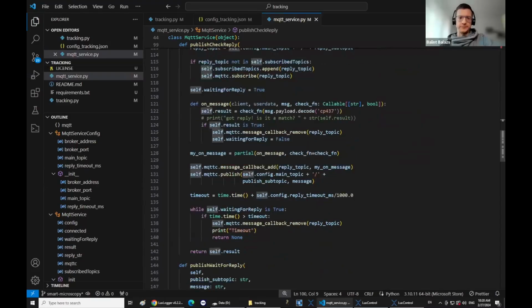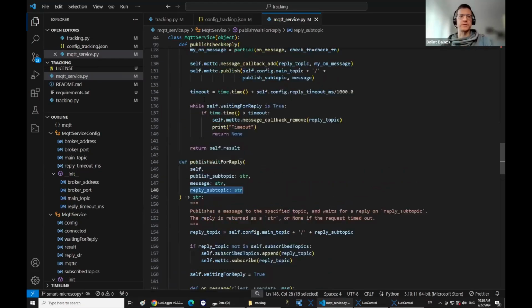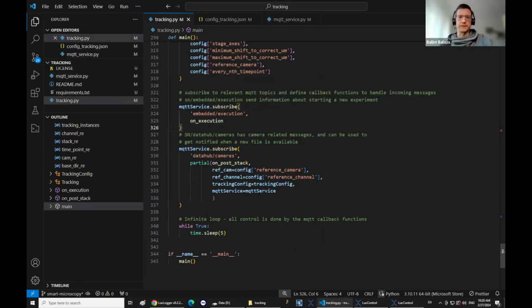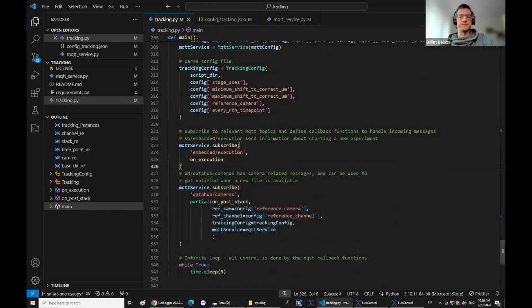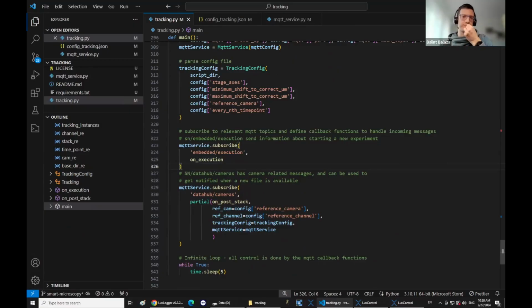Yeah, exactly. Okay, and then this one is a bit simpler. It just waits for the reply and then returns the reply string. Right. So mostly we use these two, otherwise it's a bit complicated to deal with these. But you still need to do everything asynchronously and use these callback functions because you don't know when the message will come to certain topics.